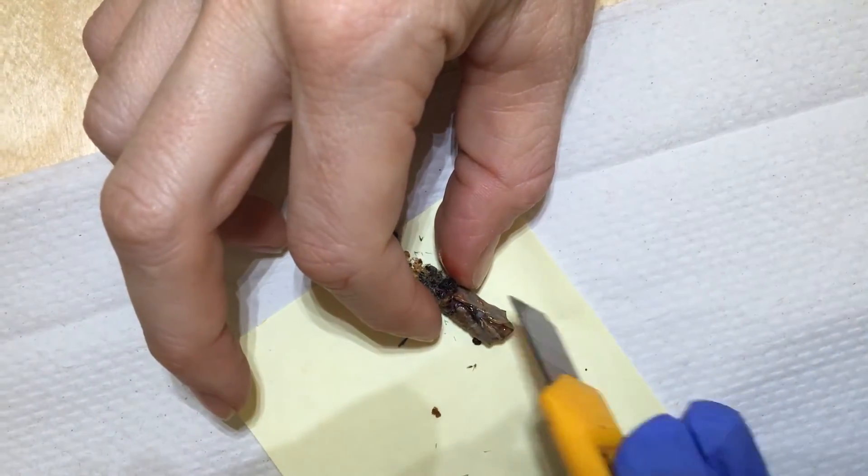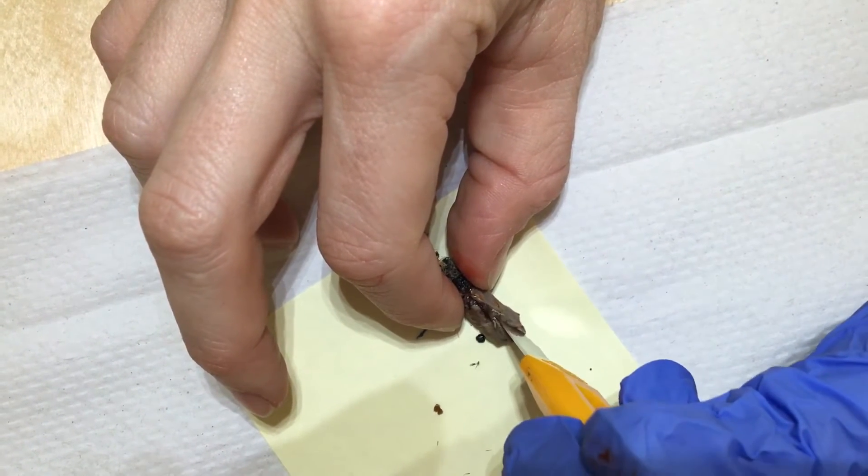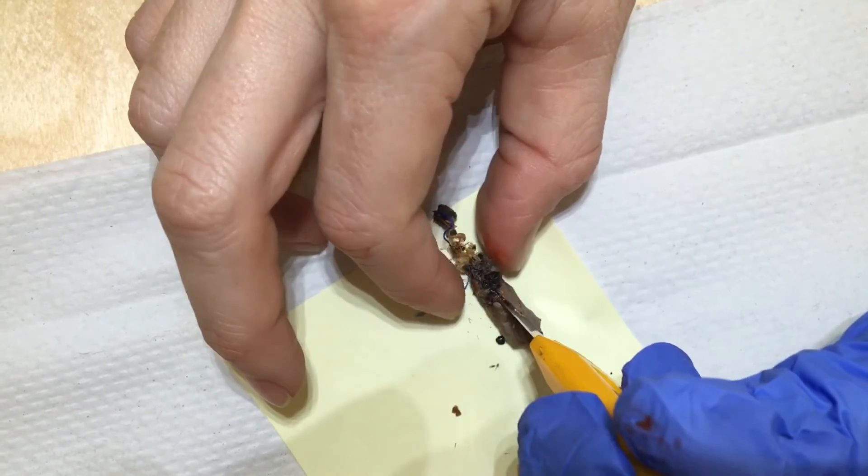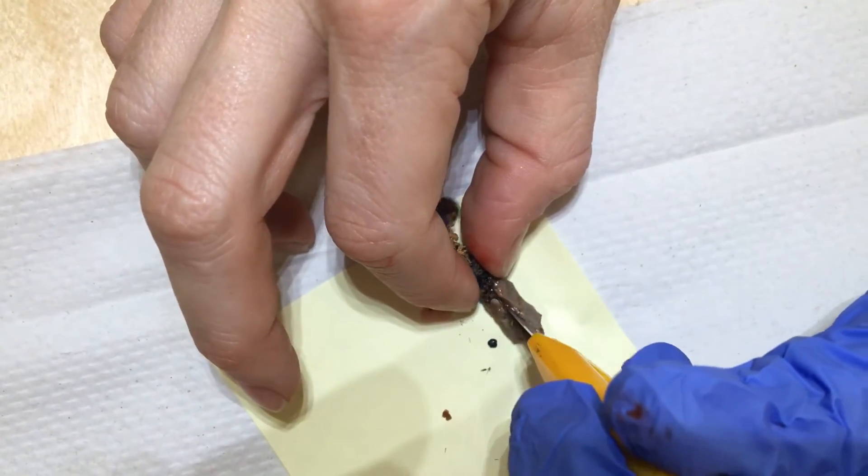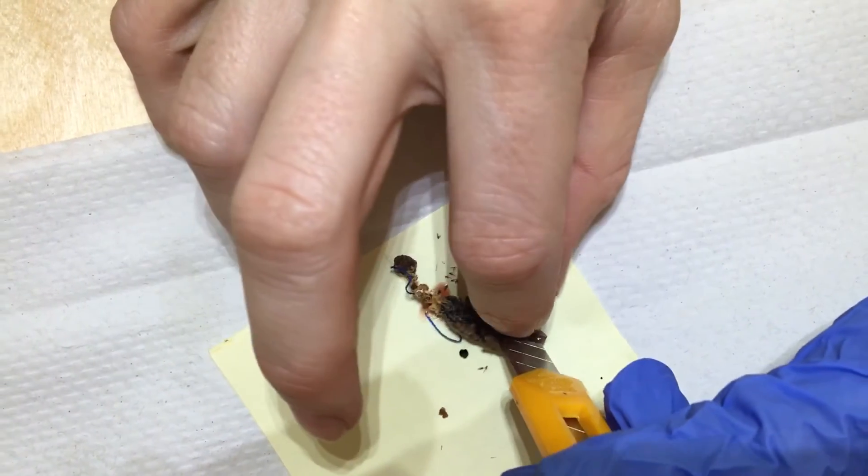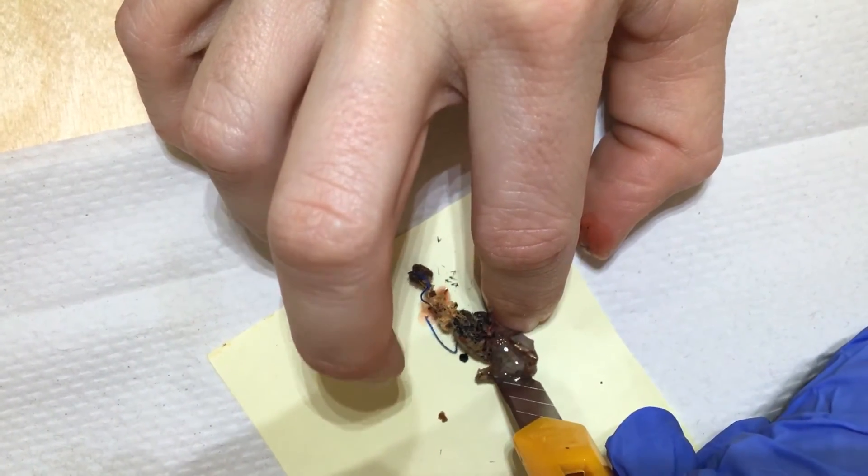I'm being extremely careful and I also know something about chrysalises and what happens inside of them that's making me feel extra comfortable as a scientist about cutting something inside and being careful.